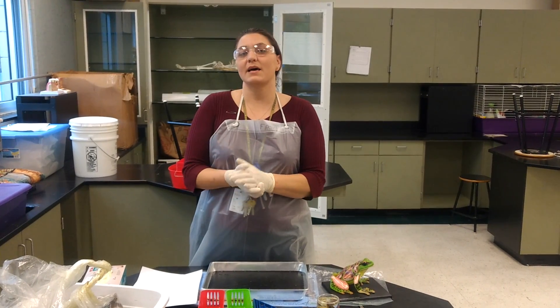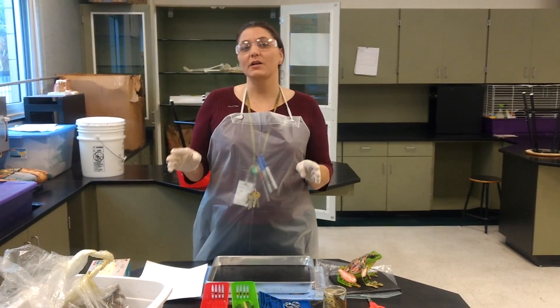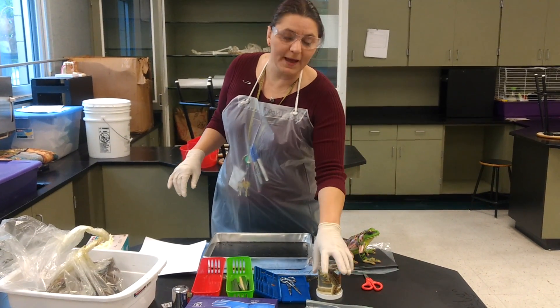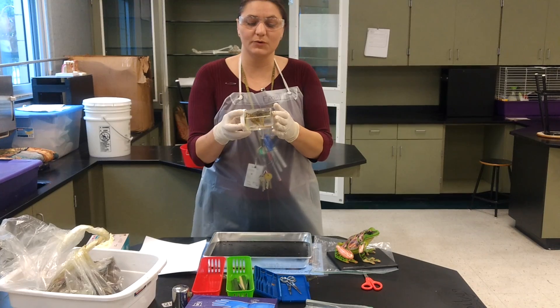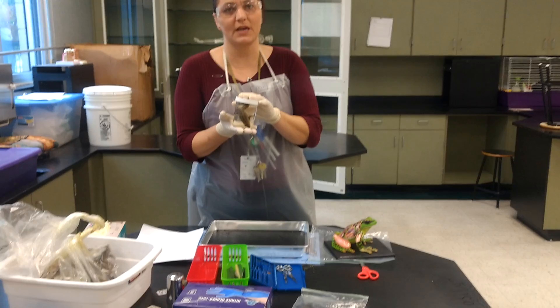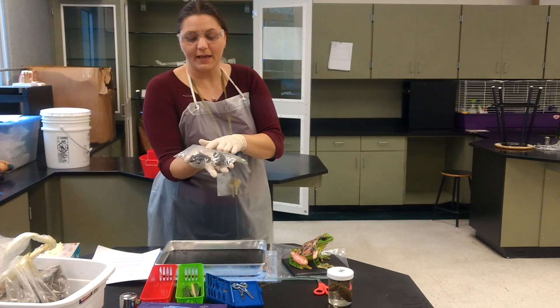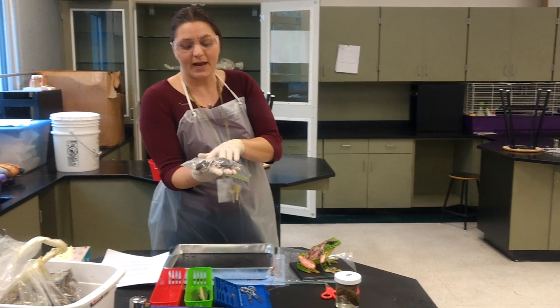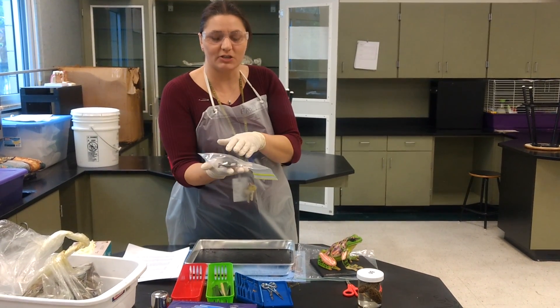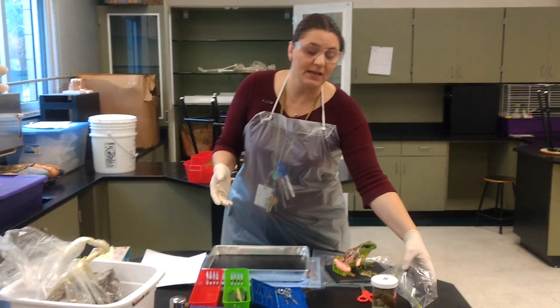We're going to go ahead — I'm assuming you're ready to watch the demonstration because we're not doing it today, we will be doing it tomorrow first thing. What I'm going to pass around is a grass frog that's been preserved — do not open this container, it will not be pretty. We also have two frogs that desiccated, or dried out and mummified. Do not squeeze them because they are fragile, very dry like jerky. Do not touch them with bare hands as they probably have some sort of bacteria.